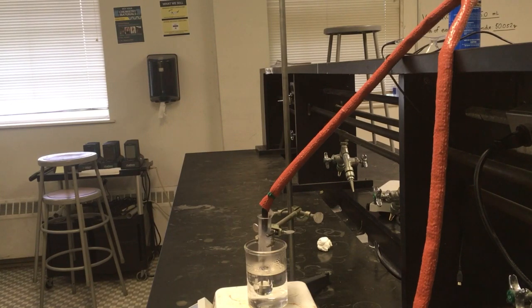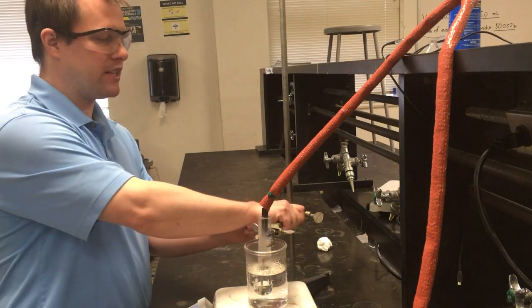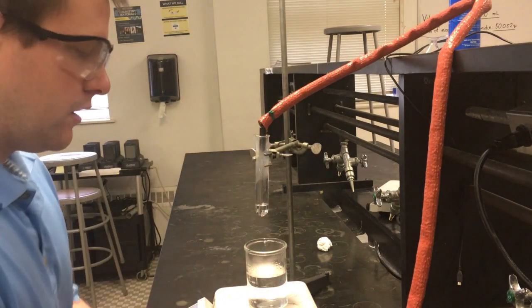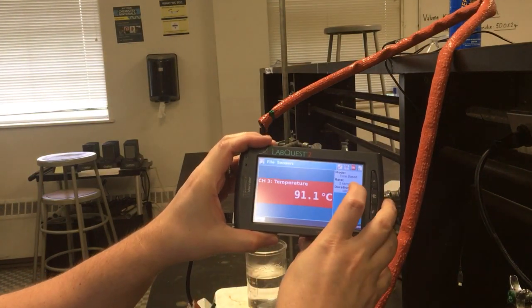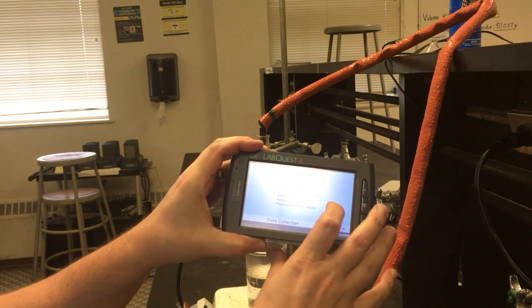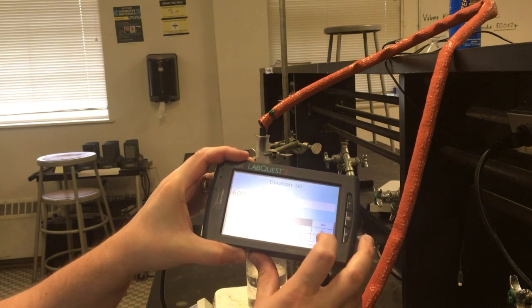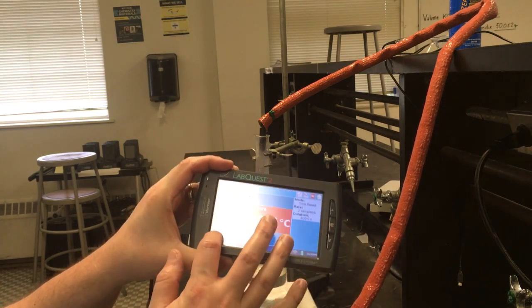All right, so at this point, all of our naphthalene is melted. So what I'm going to do is take our sample and raise it up out of our hot water bath. And on here, on our LabQuest, I'm going to show this real fast. You can see it telling us what our current temperature is. I'm going to change one quick thing here for our duration. I'm going to set it to make sure it records long enough for us to see everything we need to see. Hopefully it won't take a full 10 minutes to record everything, but we'll let that go.